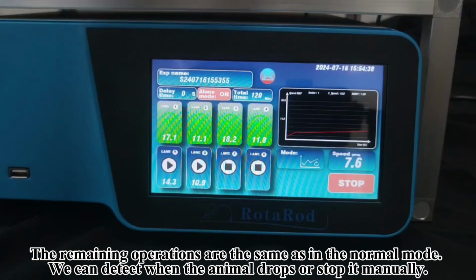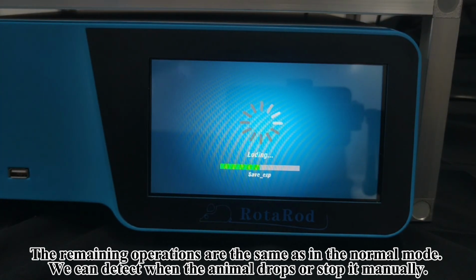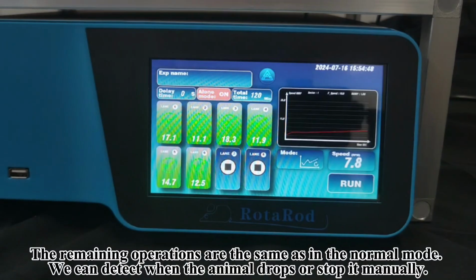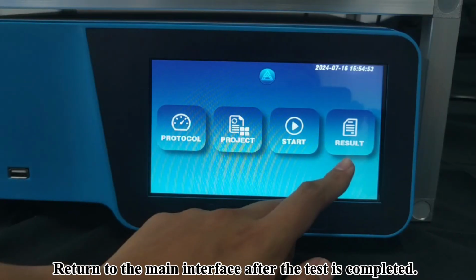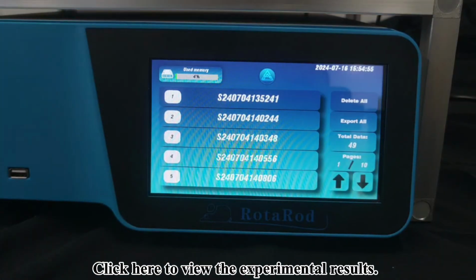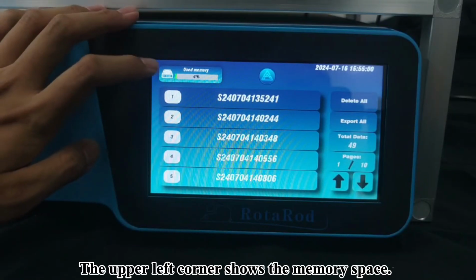We can detect when the animal drops or stop it manually. Return to the main interface after the test is completed. Click here to view the experimental results. The upper left corner shows the memory space.